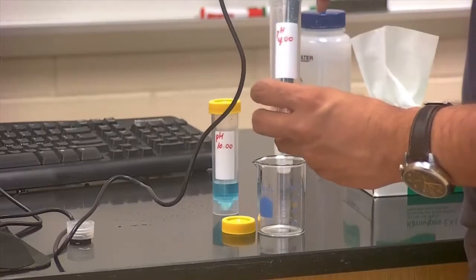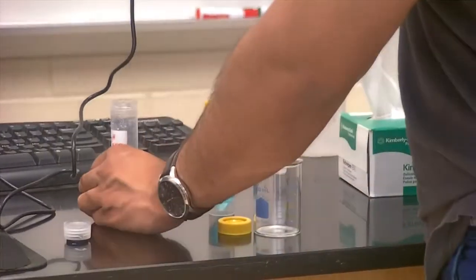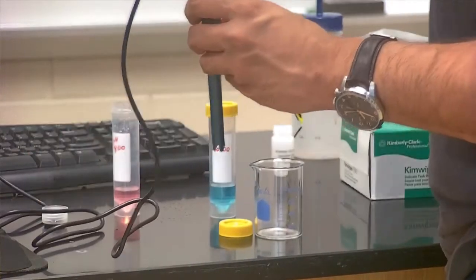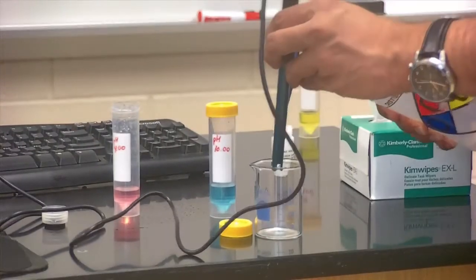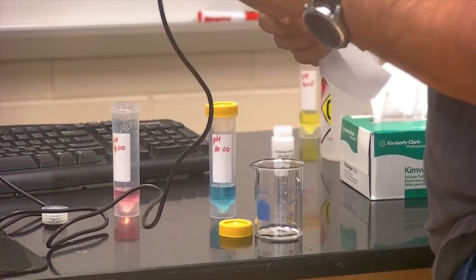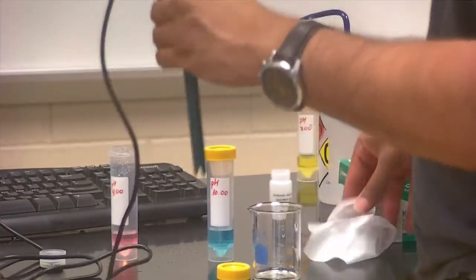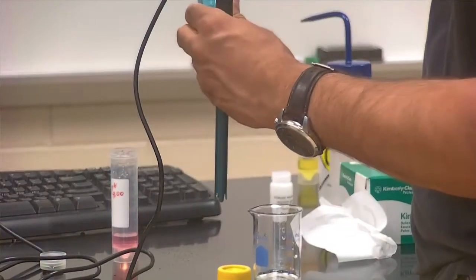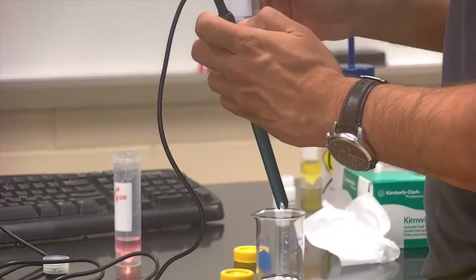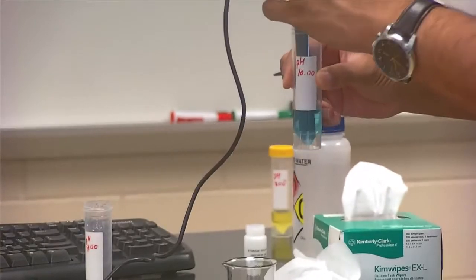All right, so now I've calibrated my first reading. So now let us get this into my pH 10 solution. So just a quick swipe after you dab it with some DI water. One healthy swipe or maybe a couple is good. And now let's put it into our pH 10. So we're going to calibrate this with pH 4 and pH 10. So let's put that in here.